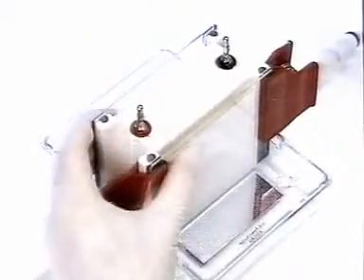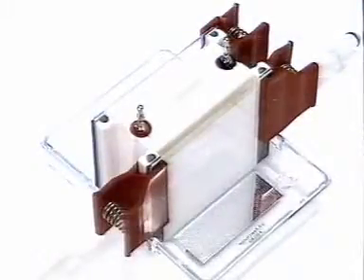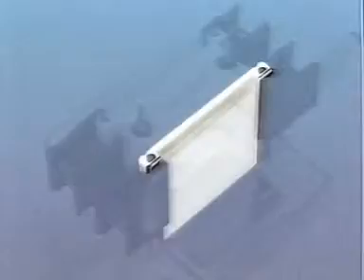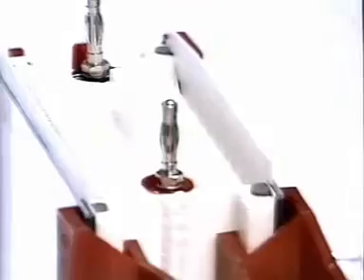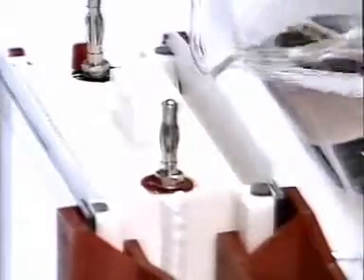In this apparatus, there are 2 separate layers of polyacrylamide gel, each 3/4 of a millimetre thick. These 2 cells are identical. Each sandwiches the gel between a glass plate in front and an alumina sheet behind. In this case, only the front cell is to be filled. The layer of gel between the plates is topped up with liquid gel. A plastic comb is used to leave wells in the gel as it sets. A buffer solution makes the electrical contacts between the gel and the electrodes.